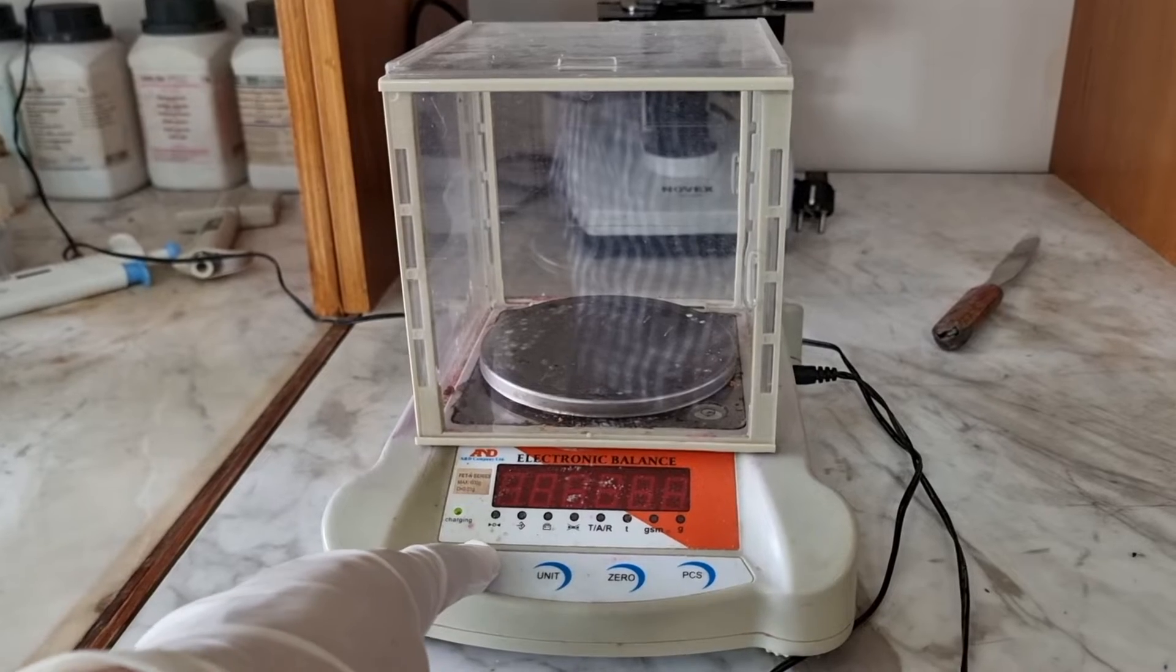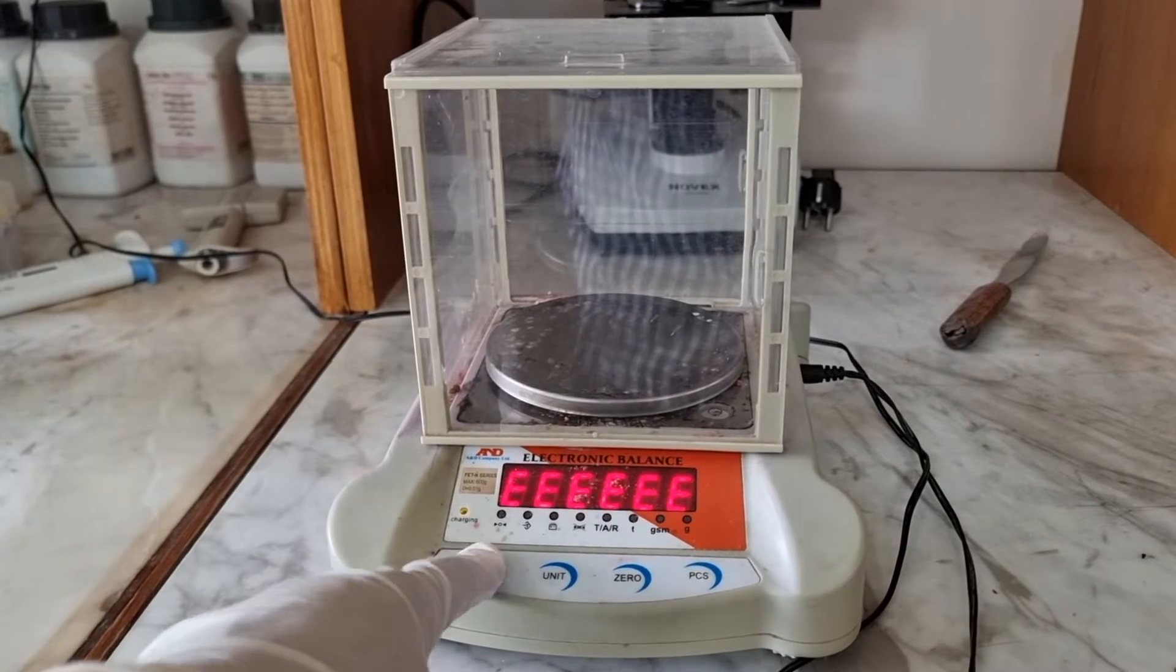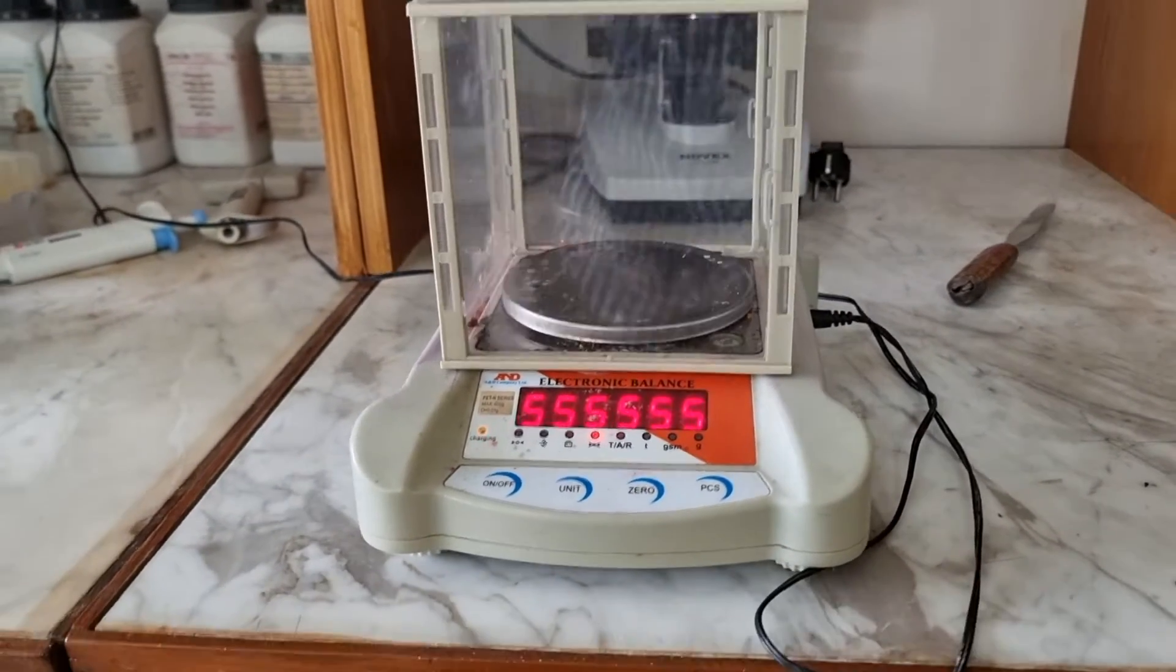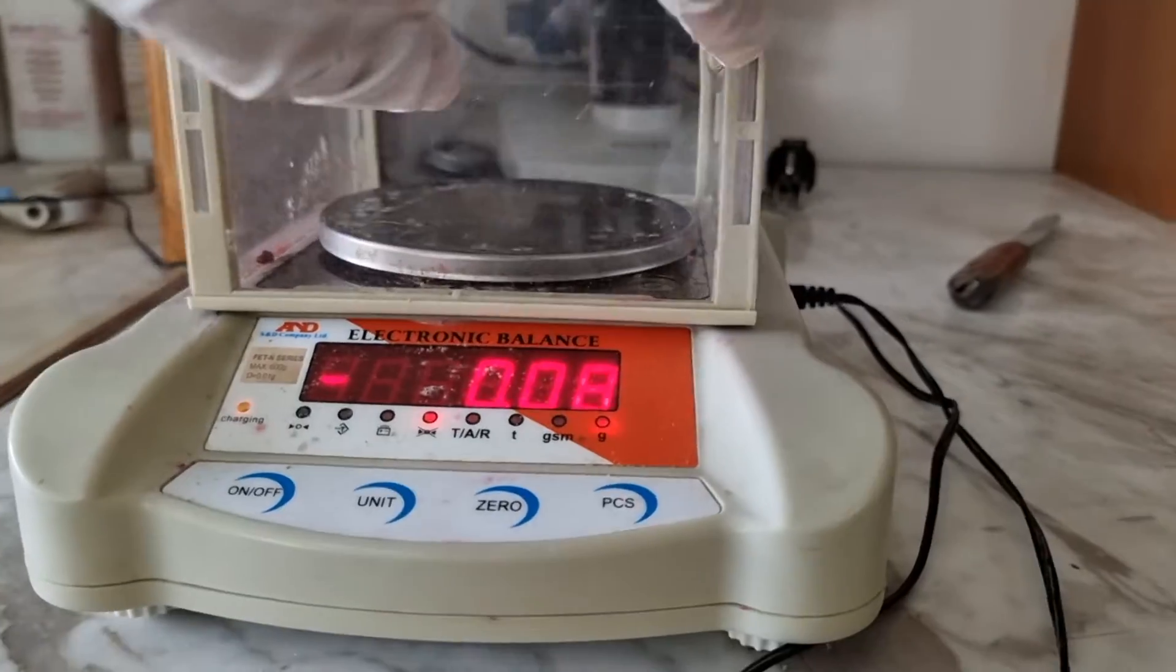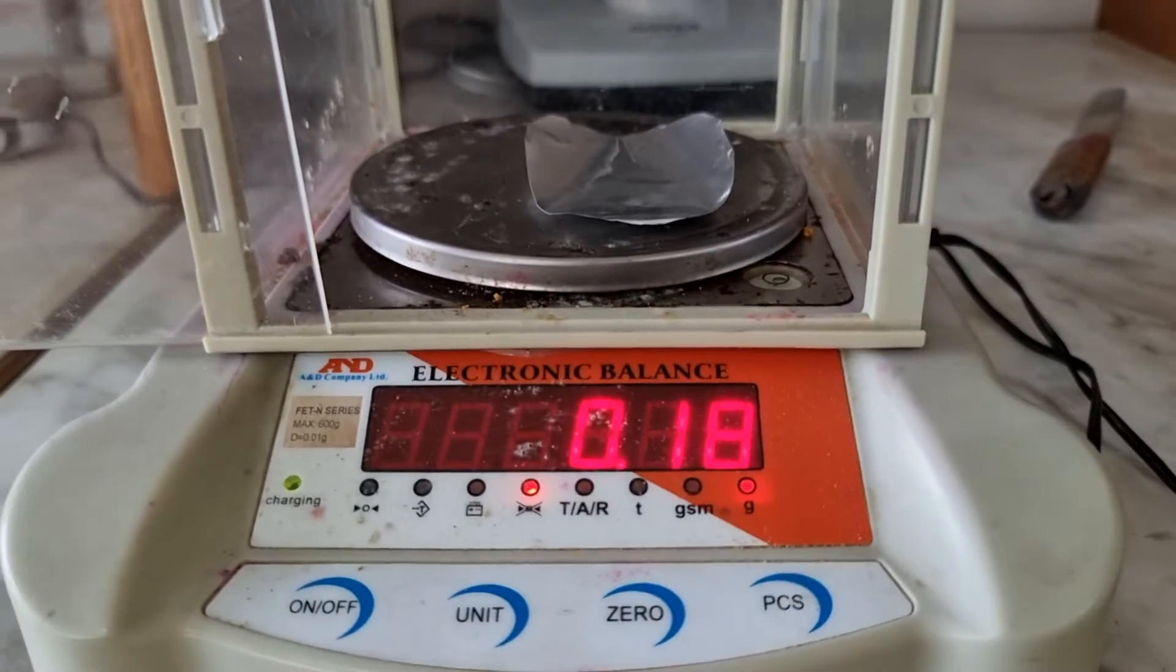Now it's time to measure the media. Let's turn on the electric balance. First of all, we have to set it to zero.